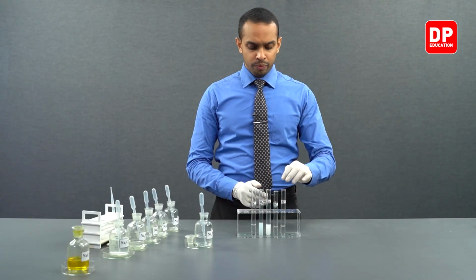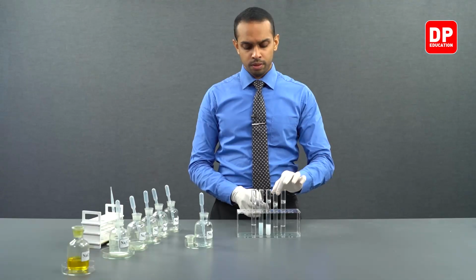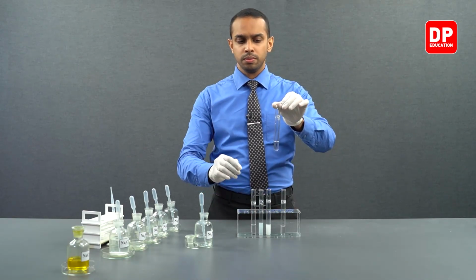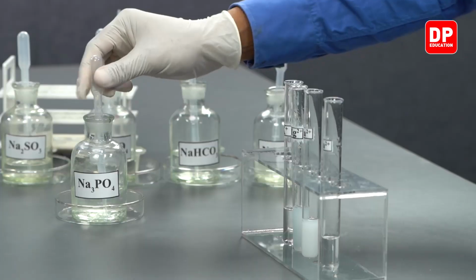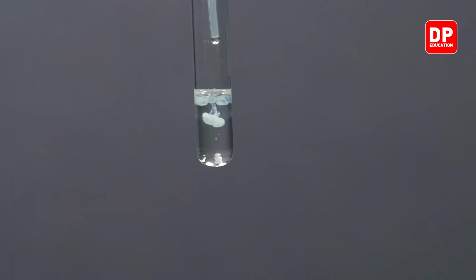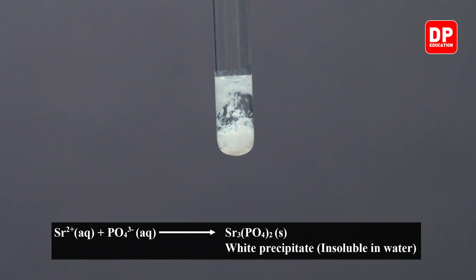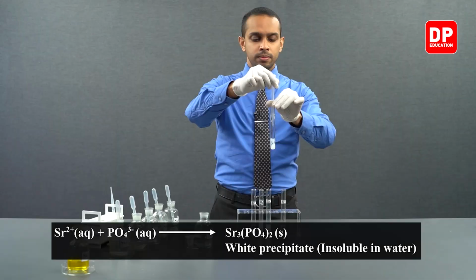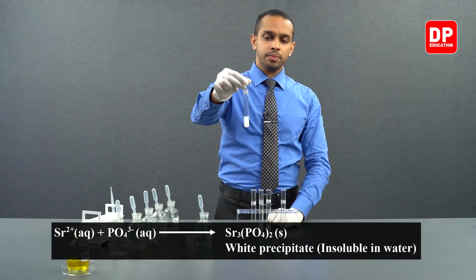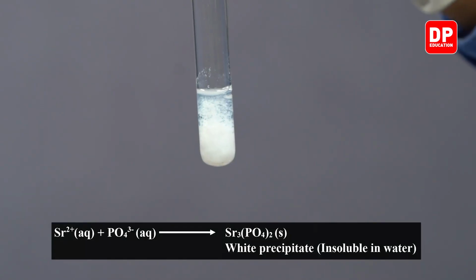Let's move on to strontium 2+ aqueous ion solutions. We have here our strontium 2+ aqueous ion solution. To that, we will be adding phosphate ions. You can see when sodium phosphate solution is added, a white color precipitate is formed. You can very clearly see the formation of a white color precipitate here.